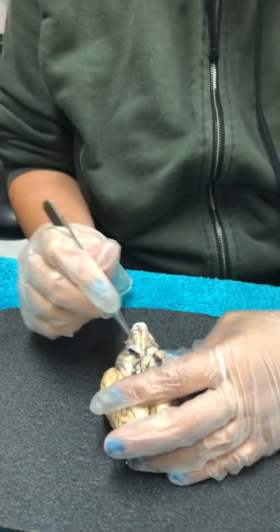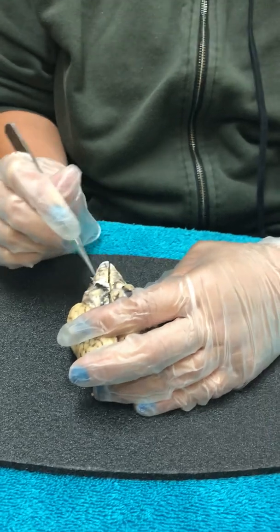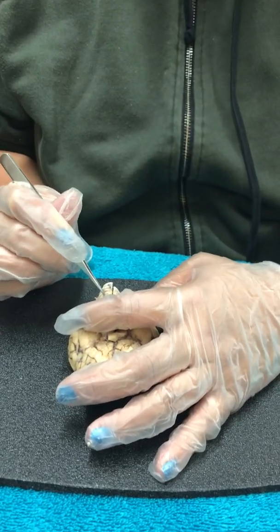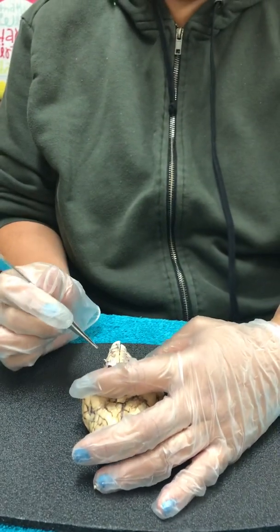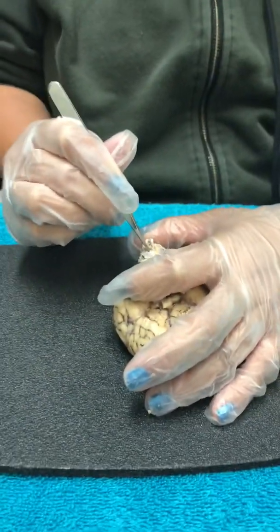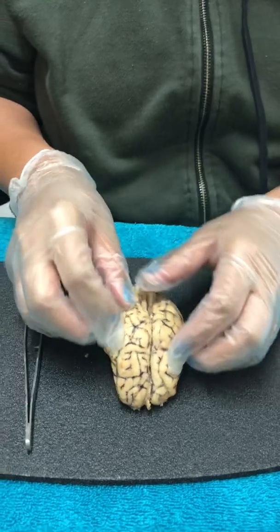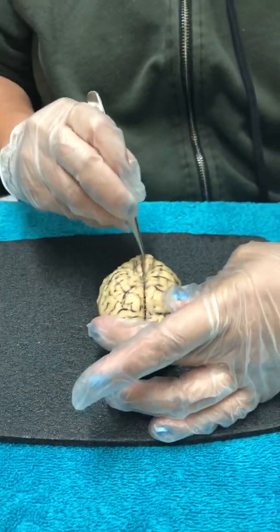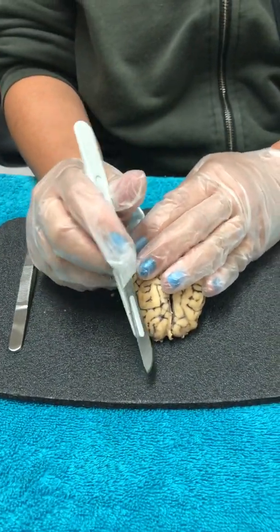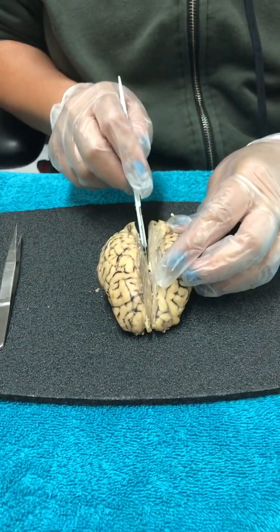That's adjacent to the medulla. So the medulla oblongata is here, this layer right here. The medulla oblongata controls involuntary action, heart rate, and breathing. And when you go down here, this is the spinal cord, where the spinal cord goes. And the longitudinal fissure is in the middle right here. As you can see, for the mid-sagittal dissection, I dissected earlier to take pictures for the assignment.